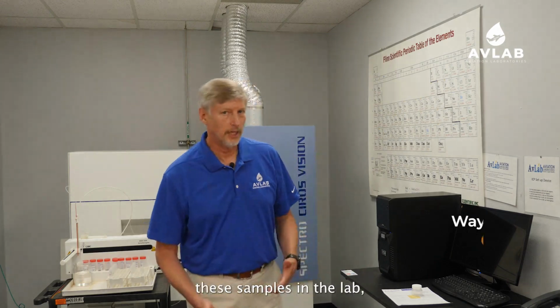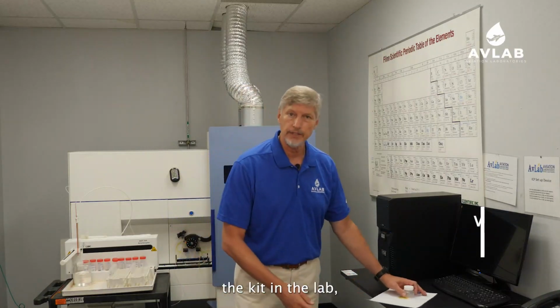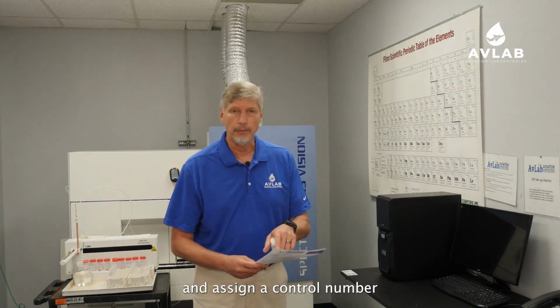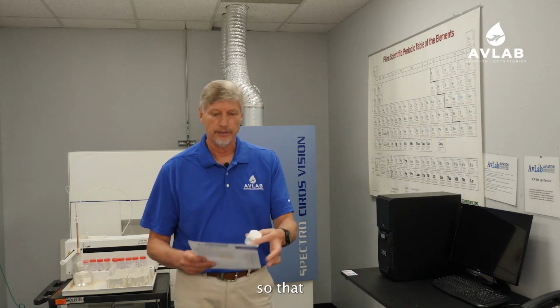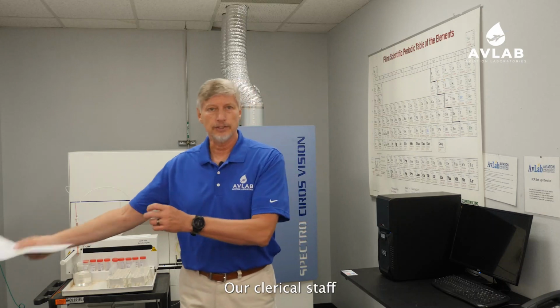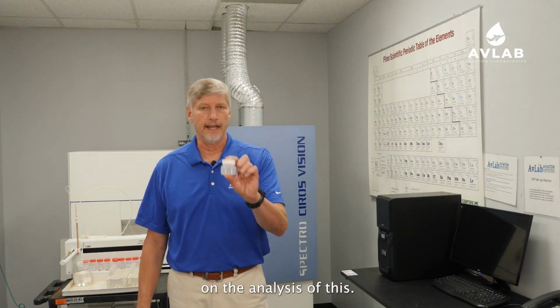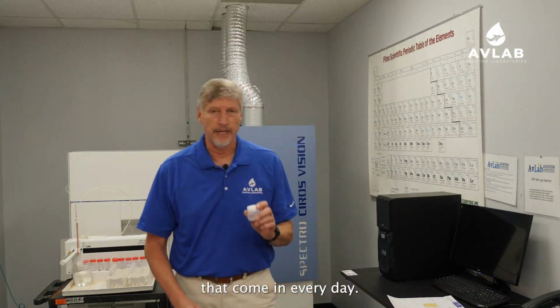Once we receive these samples in the lab, we get hundreds of these samples every day. So once we receive the kit in the lab, we actually open all the boxes and assign a control number to both the CIF and to the oil sample bottle so that we know that these two go together. Our clerical staff starts to enter this data into our computer while our technical staff starts to work on the analysis of this. So we have hundreds of these that come in every day.